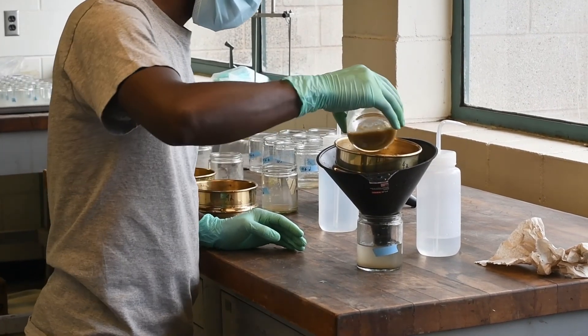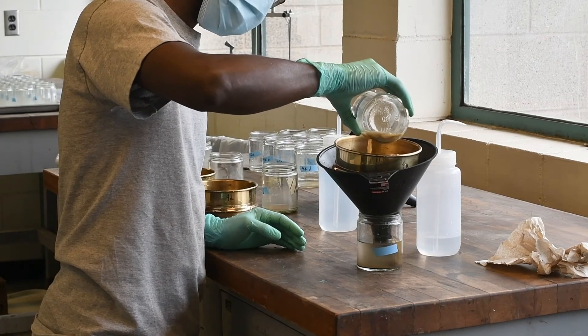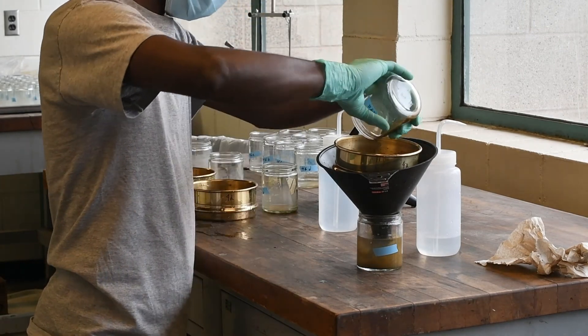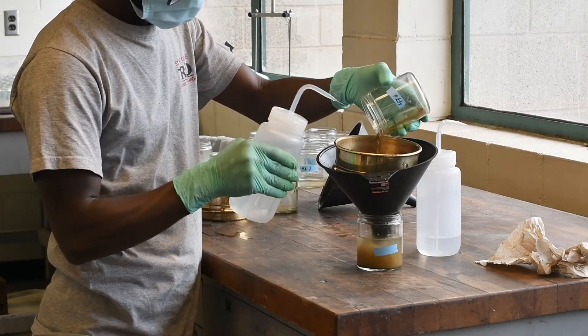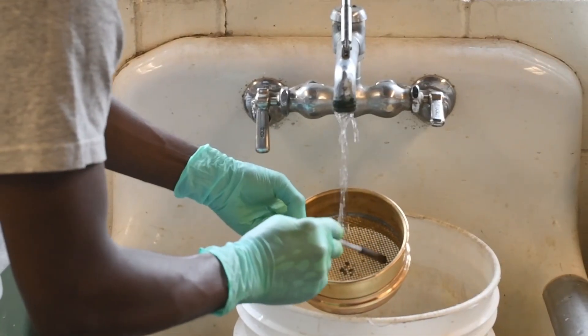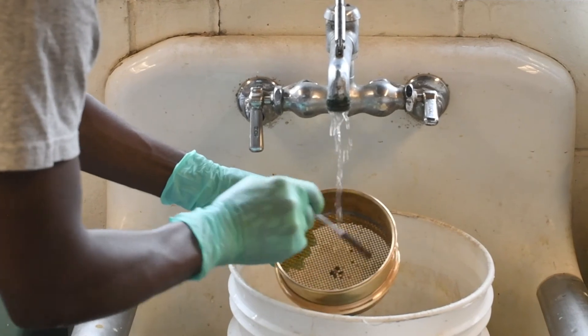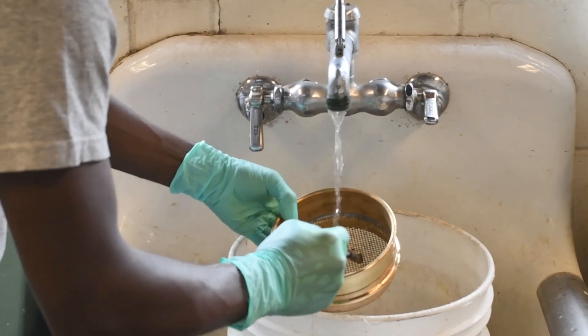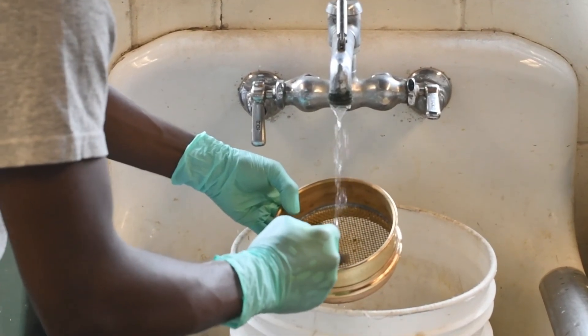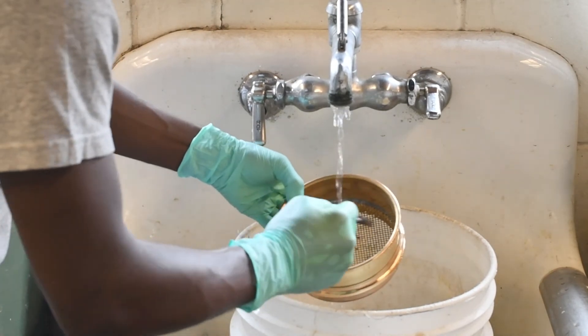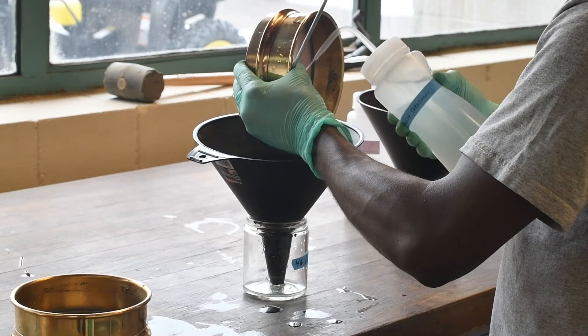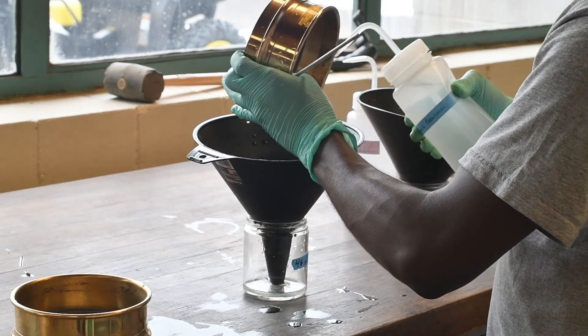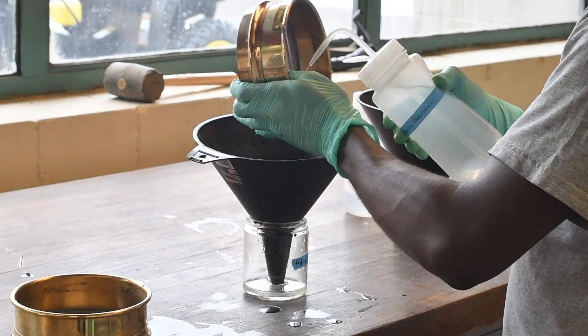For each sample, add water to the jar and use the wash bottle to transfer all soil back into the same sieve that the sample originally came from. Using a small rubber spatula, gently break up the aggregates and use a gentle stream of room temperature water to pass any soil particles through the sieve. Use a bucket to catch the wastewater and prevent clogging the drain. You'll see that the sample is ready when the water pouring through the sieve is no longer brown or cloudy.